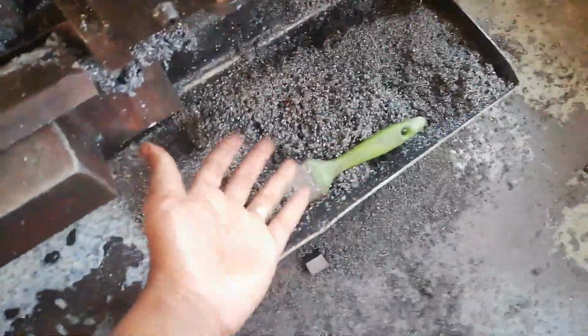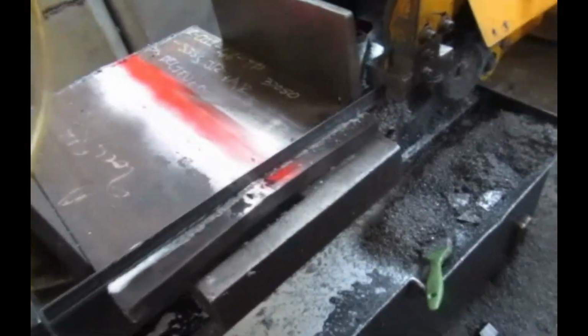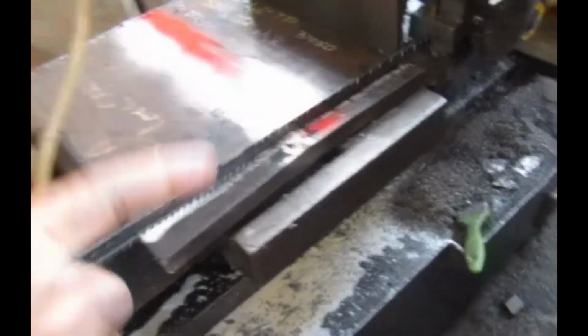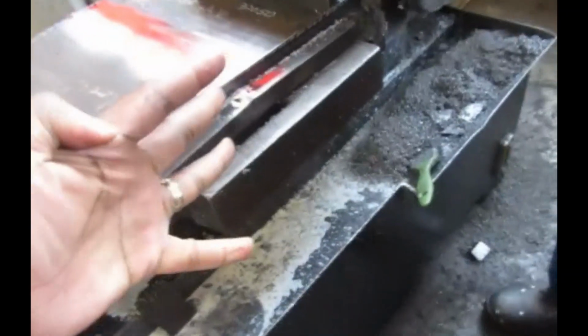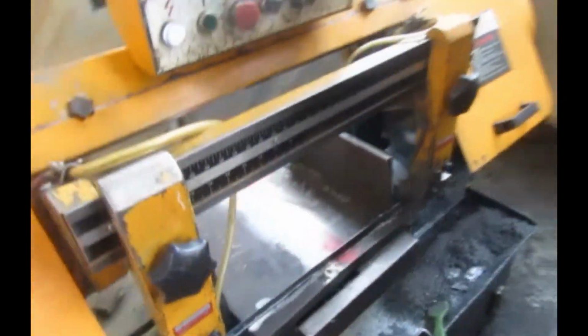But I'm not wearing any gloves on me, so yeah, I'm just trying to give you an idea of how it is. So this one here is actually a sample that has been dropped, and then here we are cutting the sample that's going to be discarded, and then here we're having our main piece that we're going to use for tensile, bend test, macro test, impact test, and all those that go with it according to the requirements of the standard that's going to be used here, right?